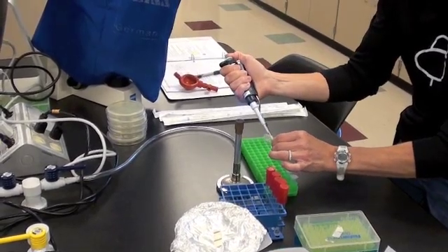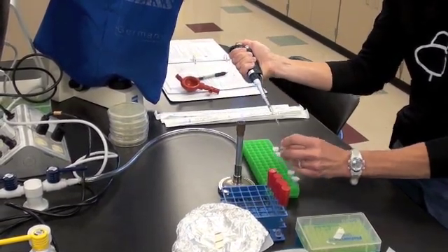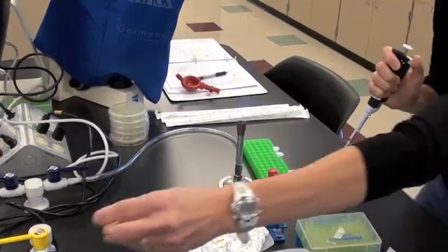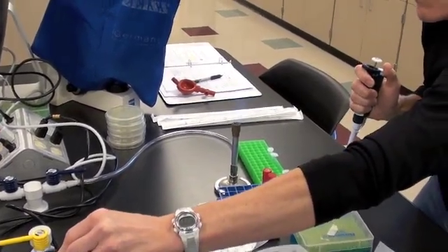Notice how she works diligently with a pattern, moving the completed dilutions to the left, discarding her tip and mixing the solutions.